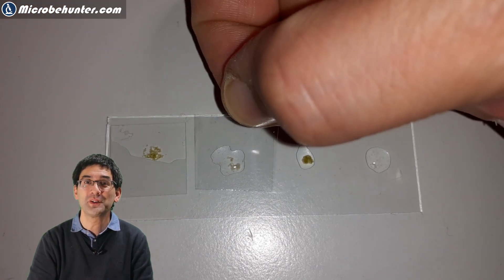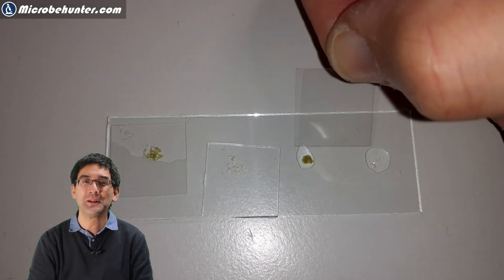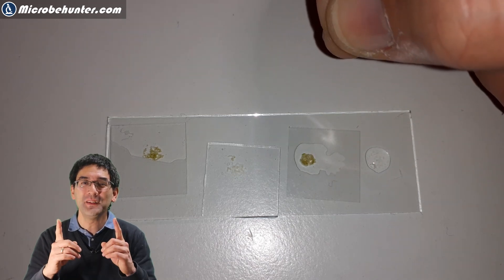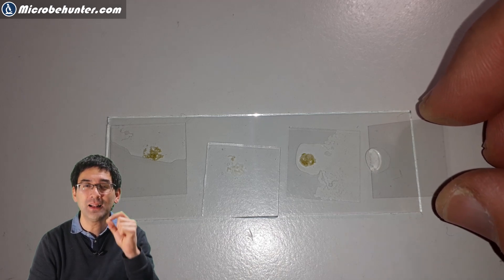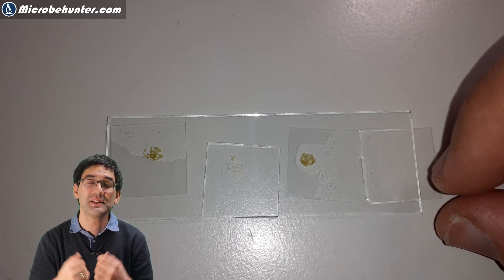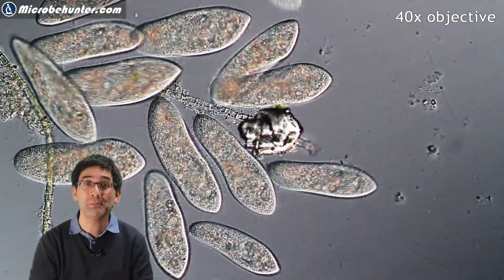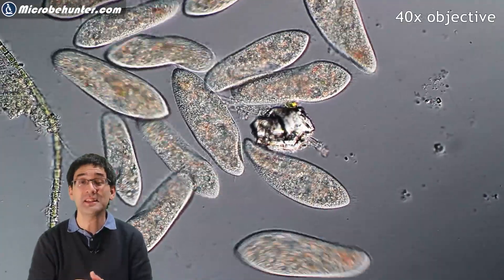Now I've simply added four water samples on one microscope slide — I have to admit that's a little bit crowded, I did run out of space, and I would not recommend that you do that. But one thing to notice is I did not add only pure water but a little bit of algae or some slimy material, some precipitate, because this is the place where most of the ciliates and other microorganisms are actually growing. What you get is a very high density of paramecia in this case.